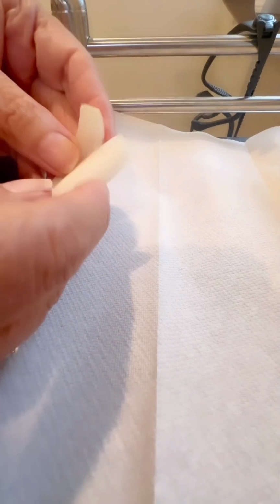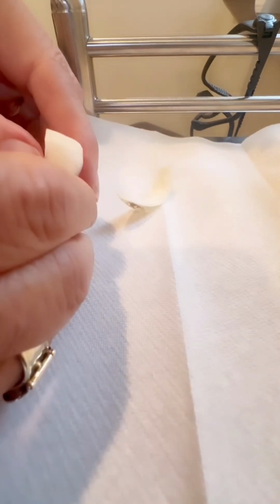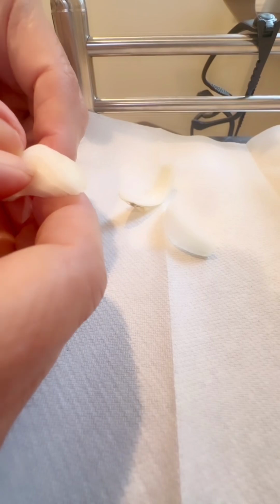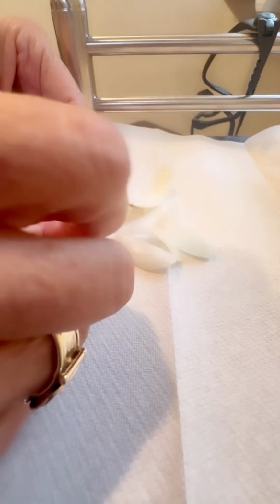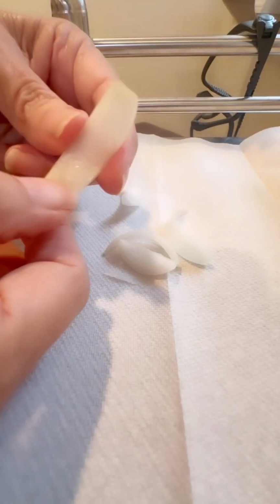Alright, I'm going to put an onion skin under the microscope, and you see the layers of flesh in between the layers of an onion. There's a skin, and it's attached.